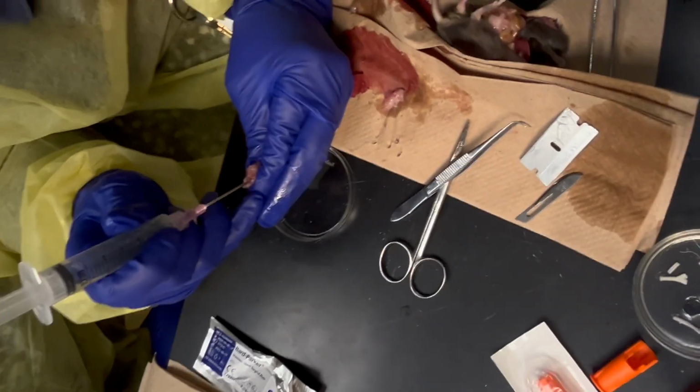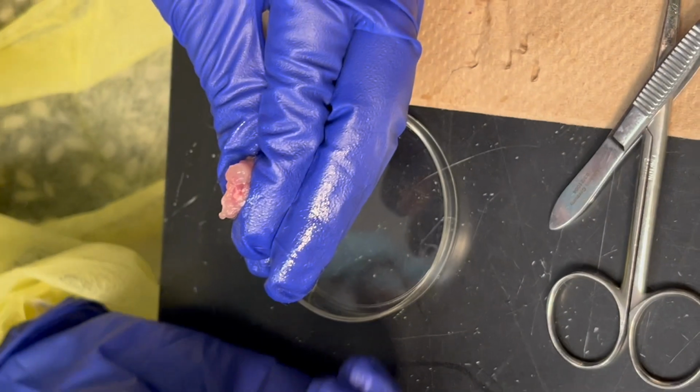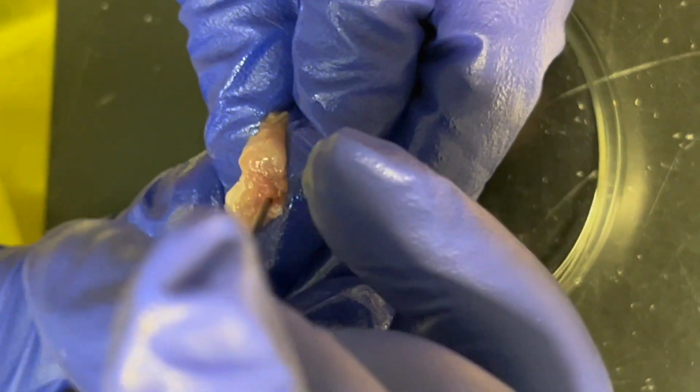Okay, so here again, this was easy, so I want you to feel. Go ahead and try doing it, just don't poke it in my face. Yes, so like right there. Do you feel it? Yes. Yeah.